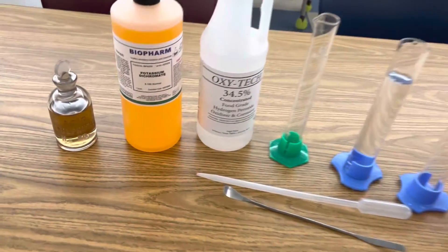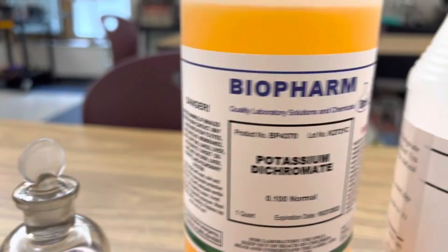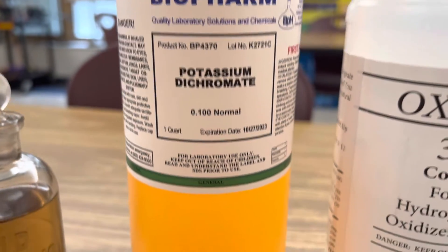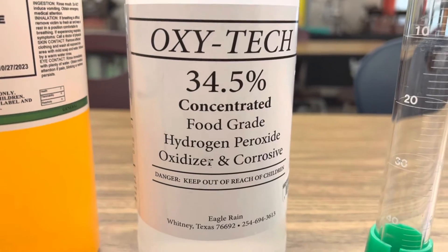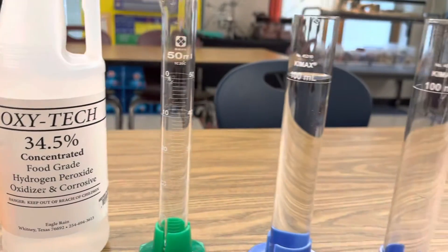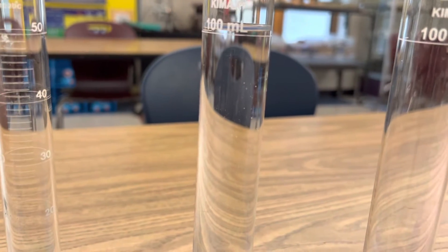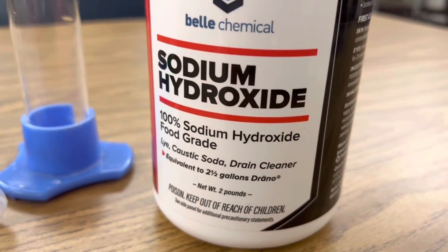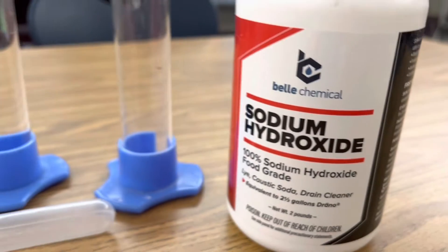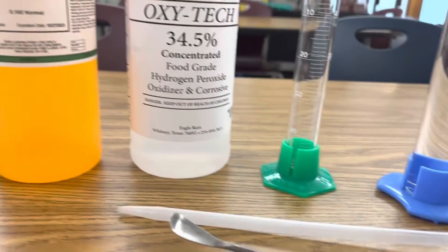All I'm using in this reaction is 18 molar sulfuric acid H2SO4, potassium dichromate in an aqueous solution, 34% hydrogen peroxide, a couple of graduated cylinders — one with 100 milliliters of distilled water — some sodium hydroxide just to step down that hexavalent chromium at the end of our experiment, a dropper, and a spoon.